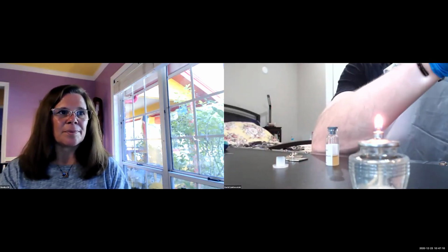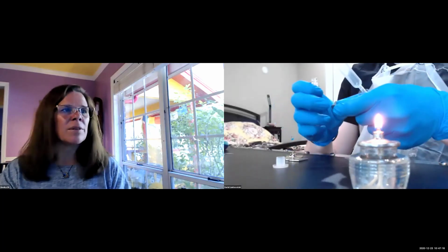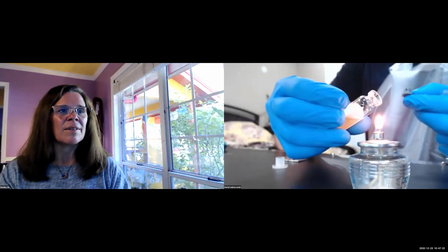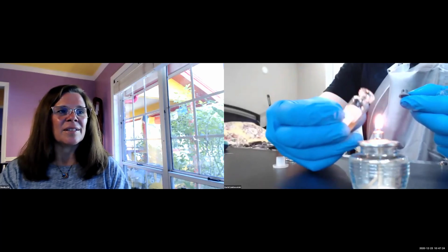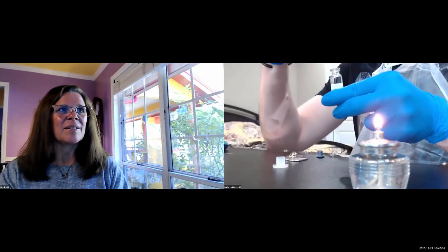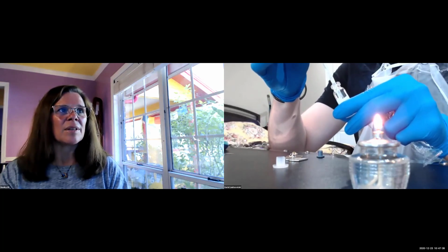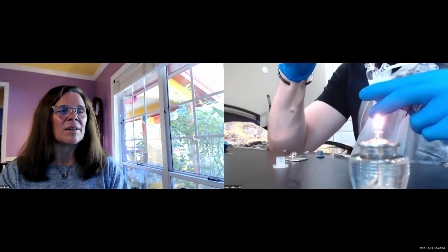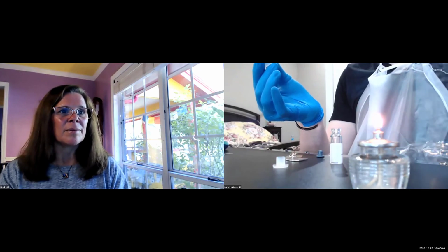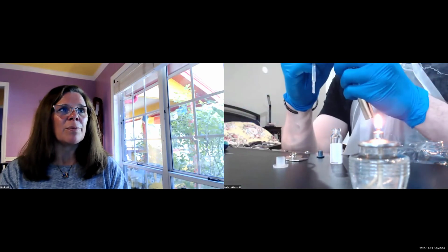So I will open this one. Will we flame it again when we open it? Yep. Always flame. It's always good practice. I'm putting this right side up. Just take everything out. And then transfer it into your liquid broth. Flame it before you transfer it. Yes.